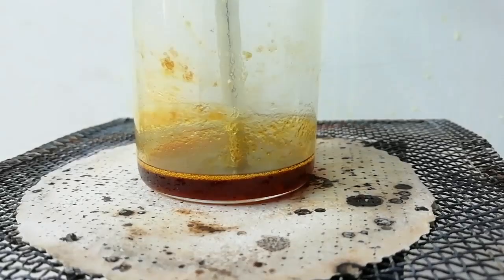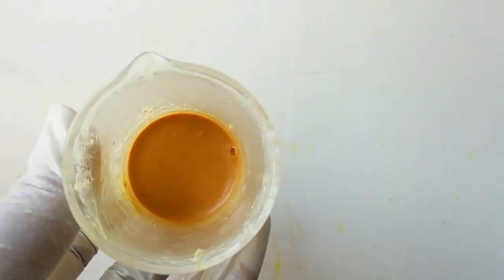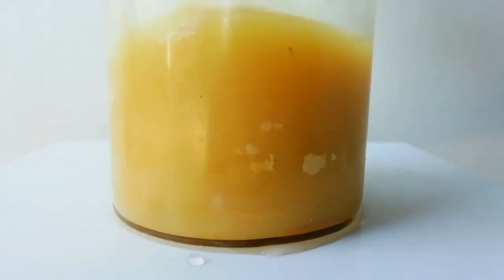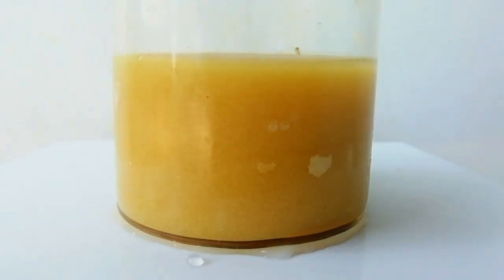After 5 minutes the mixture is kept to cool down to room temperature. After cooling down the liquid became a solid and now I added 20 ml of distilled water. Then I filtered the precipitate and washed the precipitate with distilled water twice.